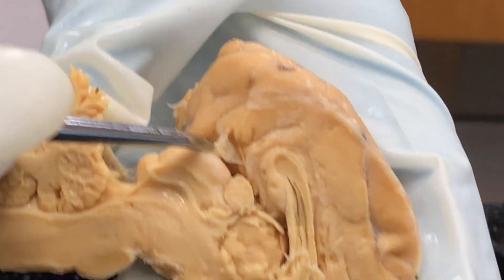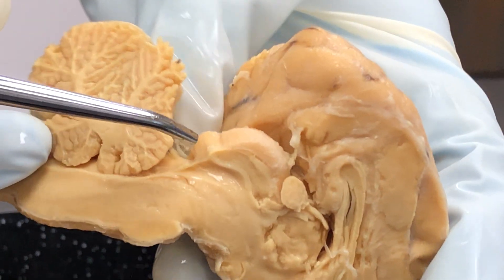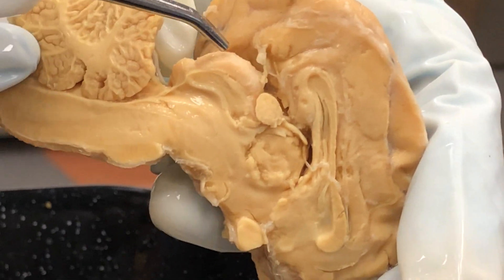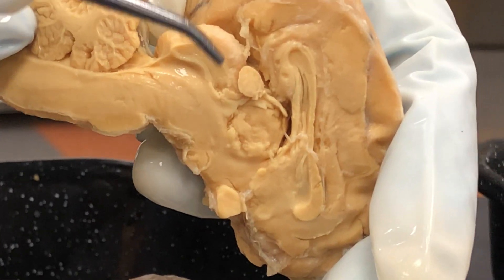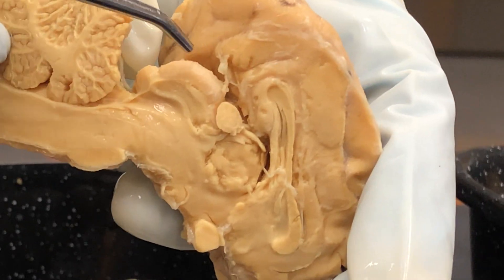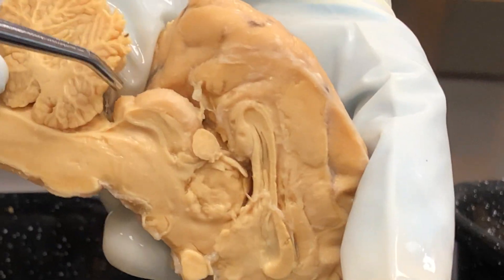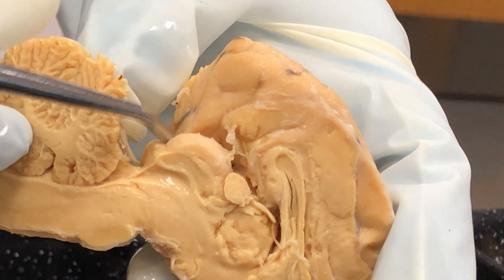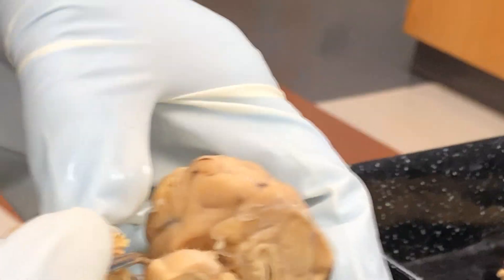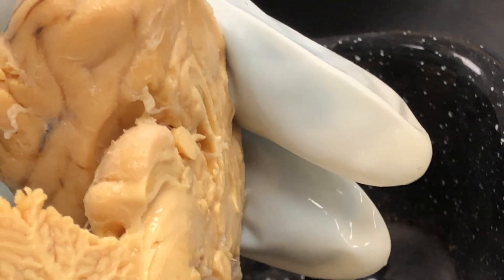Right below the pineal gland, you see this large bump — this is the superior colliculus right here; in the side view it's right here. The inferior colliculus is the smaller of the two bumps and the inferior of the two. There are two on each side: a superior colliculus on the left hemisphere and one on the right hemisphere, so there are two superior colliculi, and likewise two inferior colliculi. Together the entire thing is called the corpora quadrigemina. The word colliculus means little hill, so they're like little bumps. The superior is the larger of the two, and the inferior colliculus is the smaller.